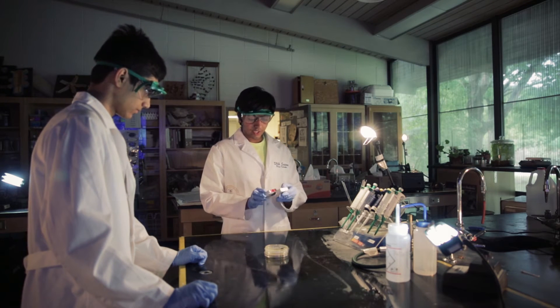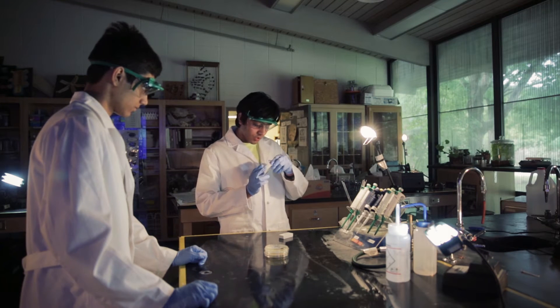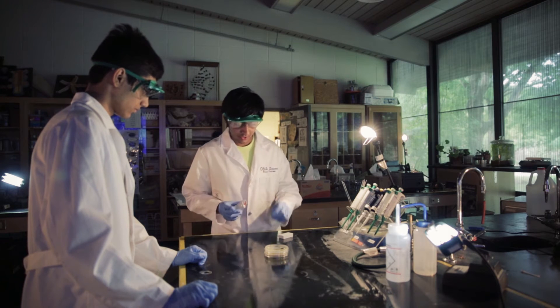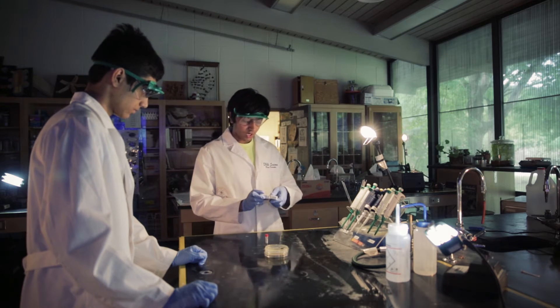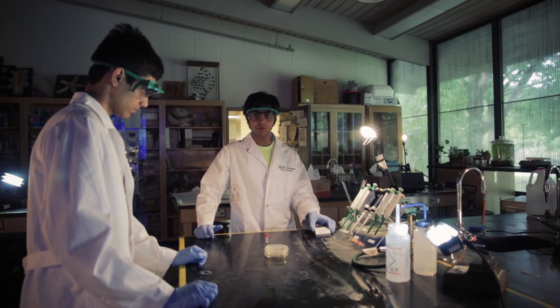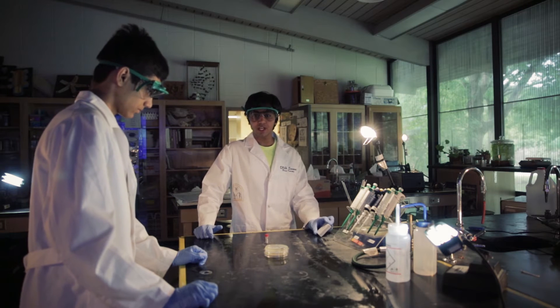Now what we're going to do to streak them is we're going to streak the A strain first. So we're going to pull that out right here. Here it is. And so this is the agar stab box and the part A and part B are stored in the PSB1AK3 backbone here. And that means they're going to be resistant to ampicillin and kanamycin.